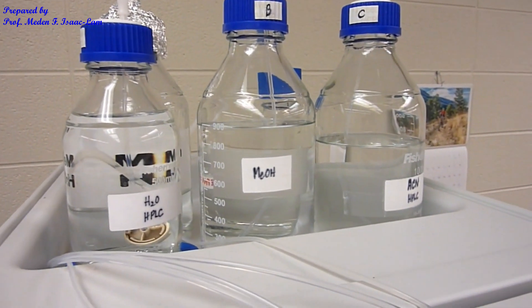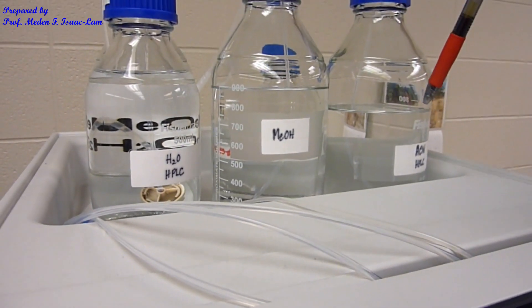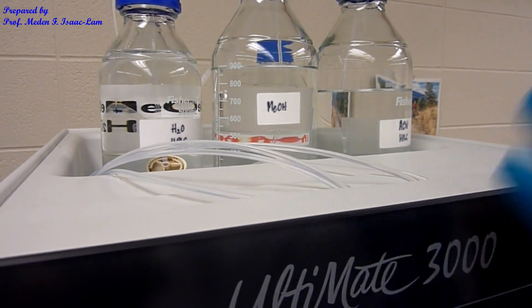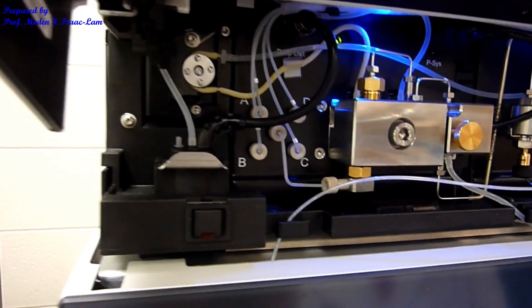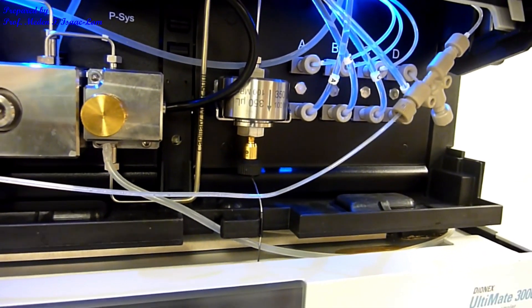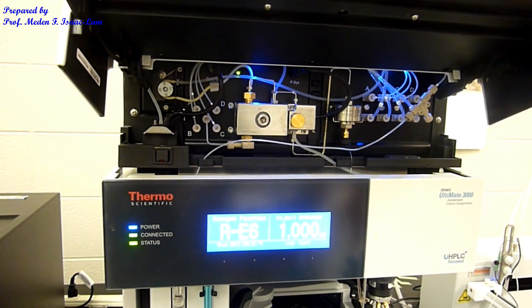The mobile phase for the HPLC — there are three solvents on top: A is water, B is methanol, C is acetonitrile. This is a reverse-phase HPLC, so the mobile phase, or the moving phase, is going to be polar — for instance, water, methanol, and acetonitrile. The pump can mix any combination of two, three, or just one solvent. D is just a rinse. You can also do what is called a gradient, meaning that you are changing the concentration of the mobile phase over time.